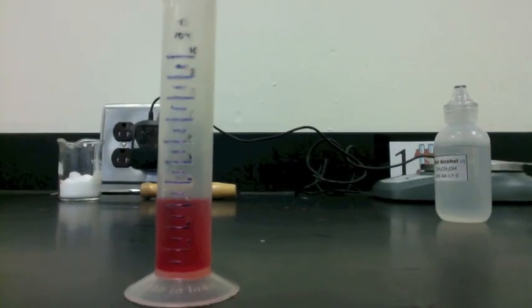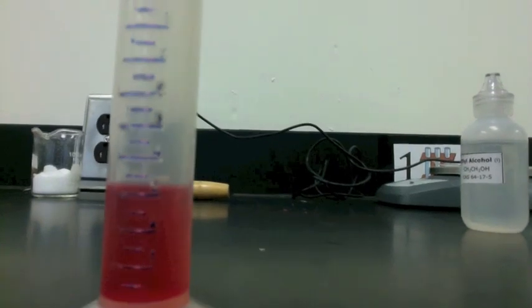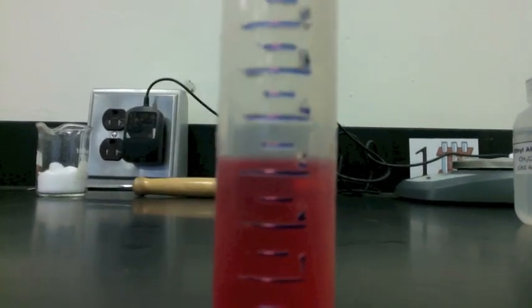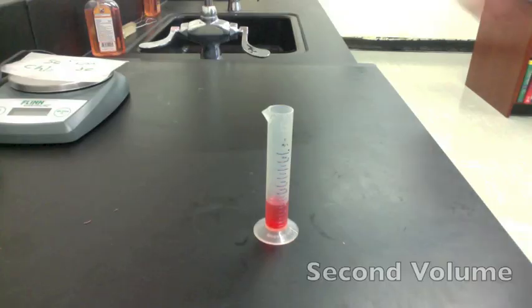To get the first volume, first you have to find the scale. To go up between 2 and 3 milliliters, there are two lines. Each line is worth 0.5 milliliters. We can see the reading is 3 milliliters.